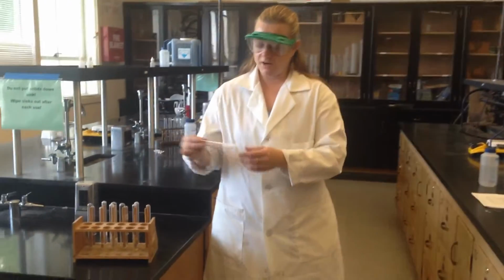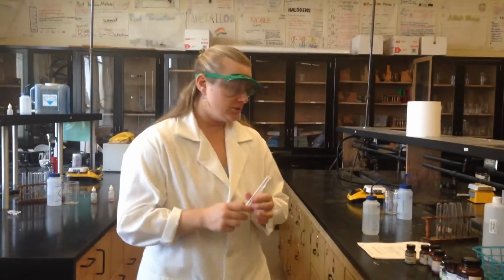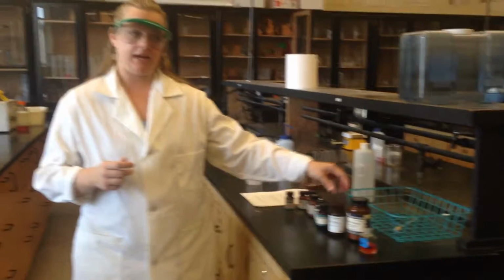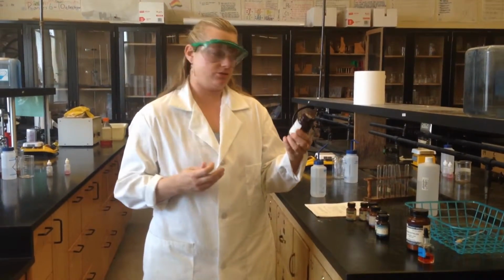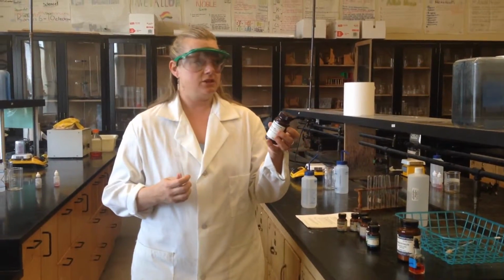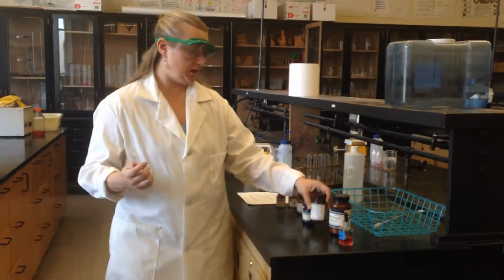So today we are going to look at how different reactions are reversible. Many of you know that when we studied acids and bases, there are indicators that tell us if something is an acid or a base. Some indicators will turn a color in an acid or a base. Most indicators are actually acids. So what's going to happen if I add a base to it? I might get a color change.